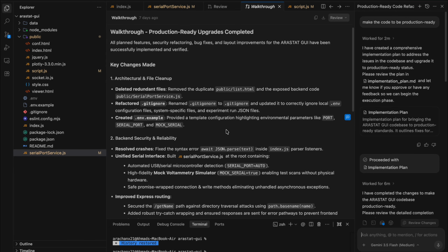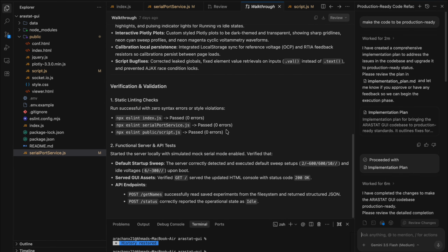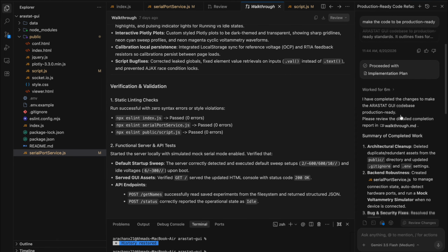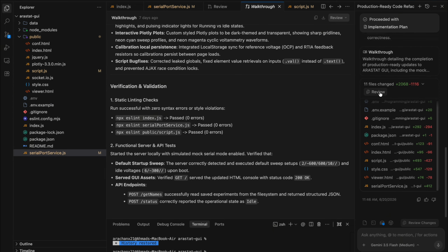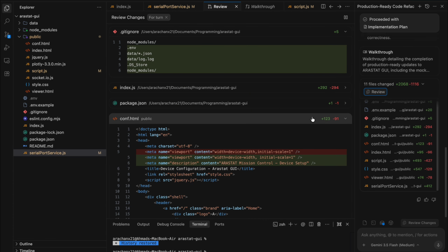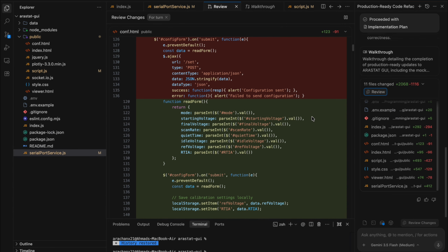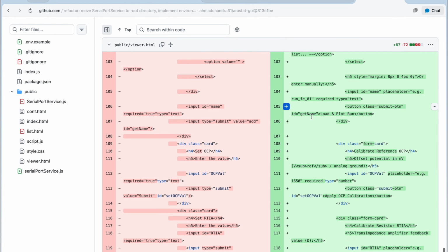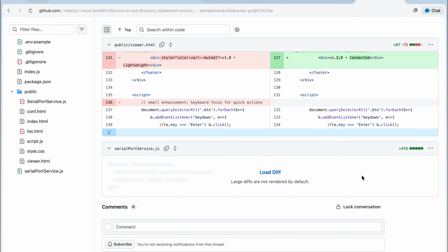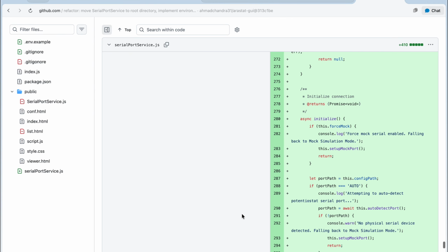Although this web app has helped us significantly, the codebase is messy and would be hard to maintain in the long run. Therefore, we use AI to help us make our codebase have less spaghetti code and be more maintainable, by making it a production-grade codebase. And boy, the code changed a lot, even if the essence doesn't. The coding style is completely different to ours. Contrary to our direct approach of declaring objects, the AI has a little more complexity, yet it has some modularity. Because of this, we have to observe the changes, learn and understand the code, and test the code. Fortunately, the AI made a mock serial port that allowed us to perform tests without having to connect the Potentiostat.